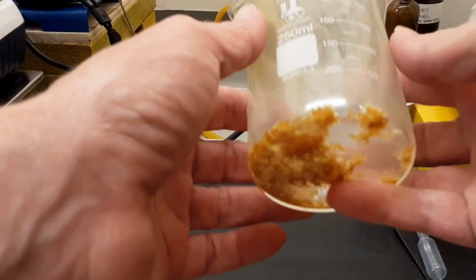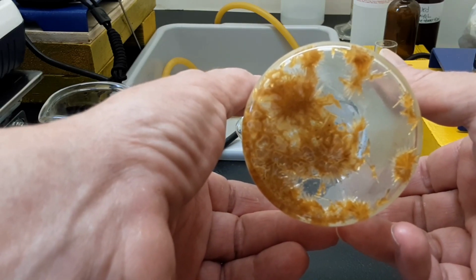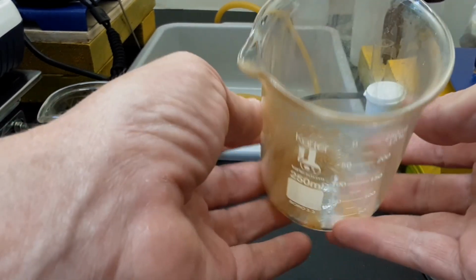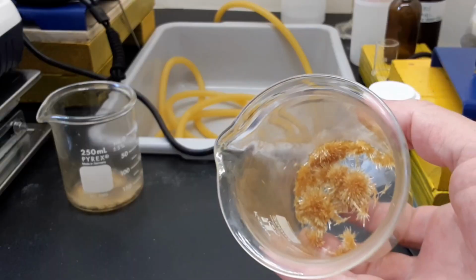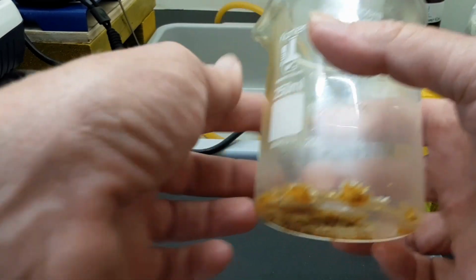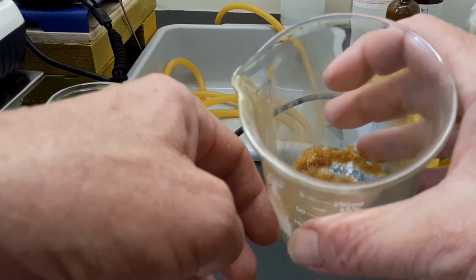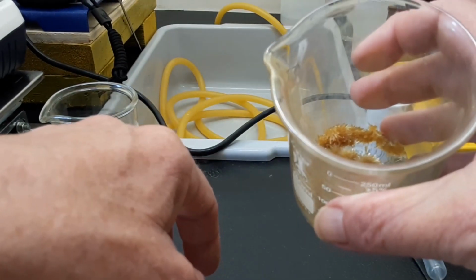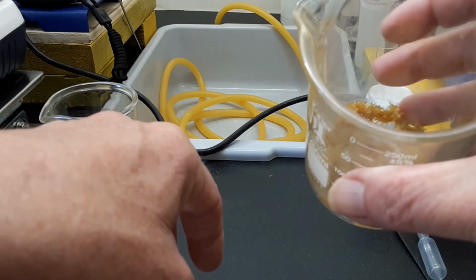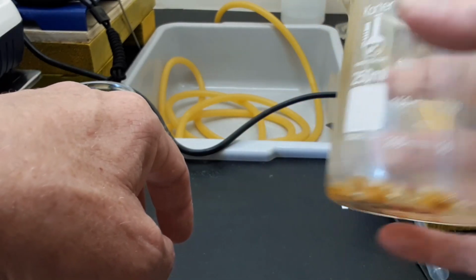Now this one here was 200 grams of white pepper, which was extracted in ethanol. The last measure on it was 15 grams prior to going into this beaker to crystallize. It's got very nice crystal structures to it, but unfortunately it's brown. I just don't know what to make of it. So I did the same thing here. I got frustrated. I shot a bunch of cold acetone into it, shook it up, and dumped it out really, really quick. Of course, brown came with it, but piperine came with it. So once again, I just don't know.